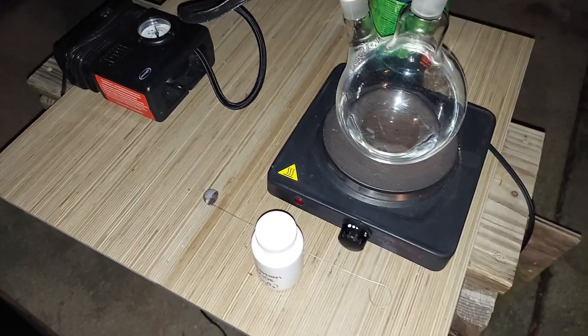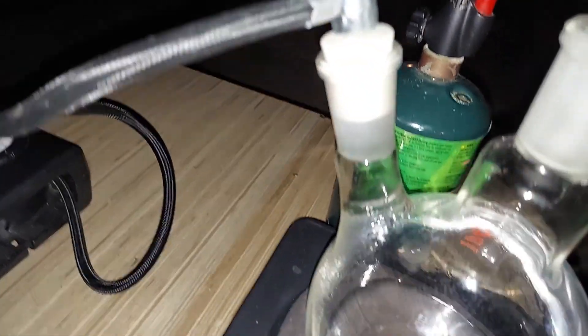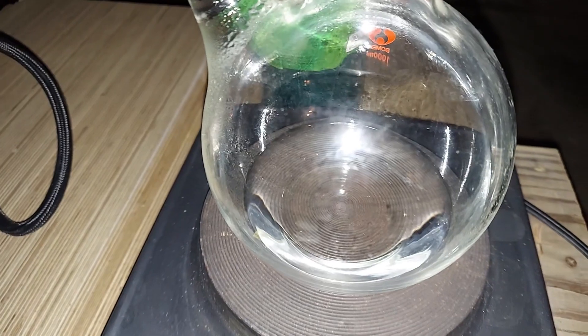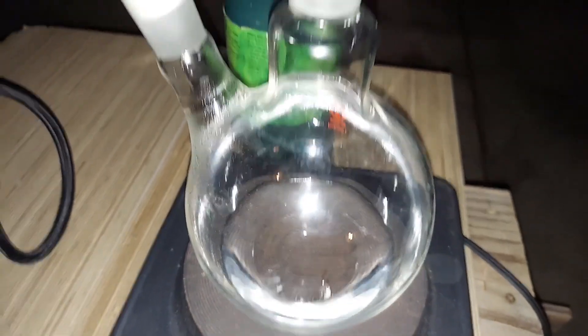It's nighttime and I'm ready to do this. Here's my power source that's going to provide the 12 volts needed for the air generation. There's the needle that goes through there. This is ammonia down here, liquid, and when that's heated up it'll turn into a gas.